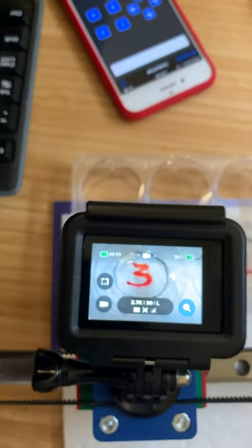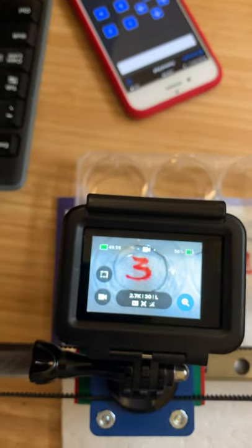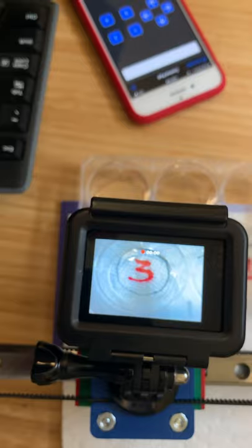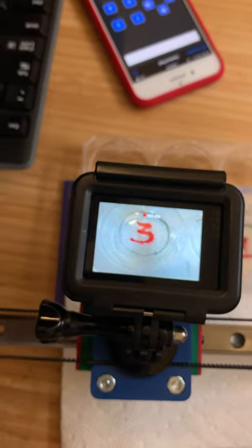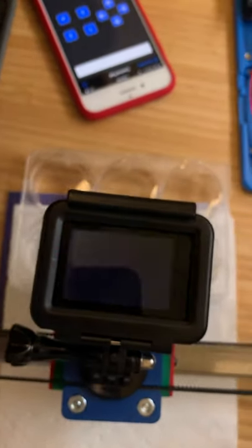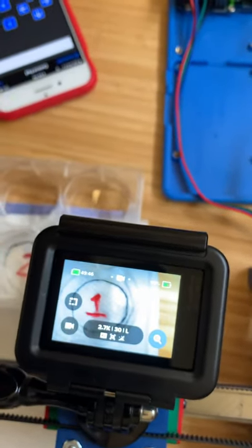Now it's moving to the next, the third cell in this well plate. After the delay when it settles and gets there, it's going to record, and I've set that again for the default of 10 seconds. Okay, and when it finishes that 10 seconds of video, it's going to move back to the beginning, back to the first cell, back to there.